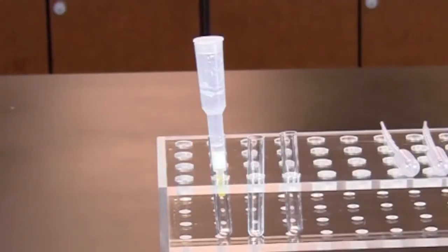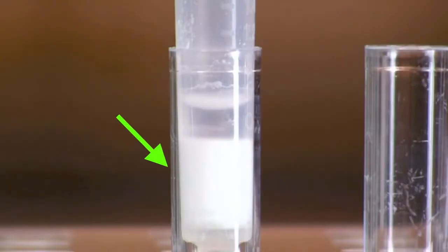In this activity, we will be using an HIC column that is filled or packed with a hydrophobic resin. In a high-salt buffer, hydrophobic proteins bind to the resin.